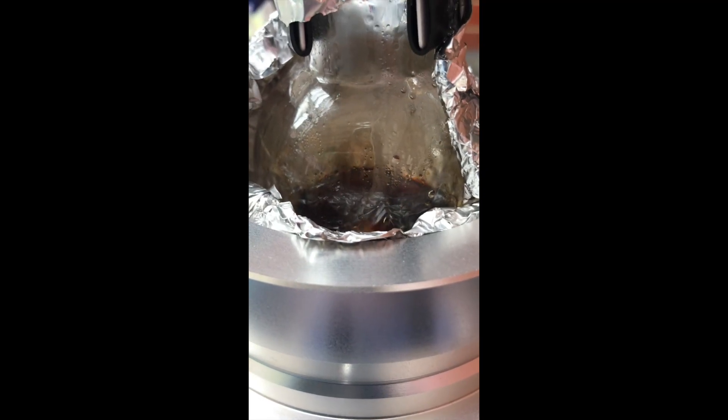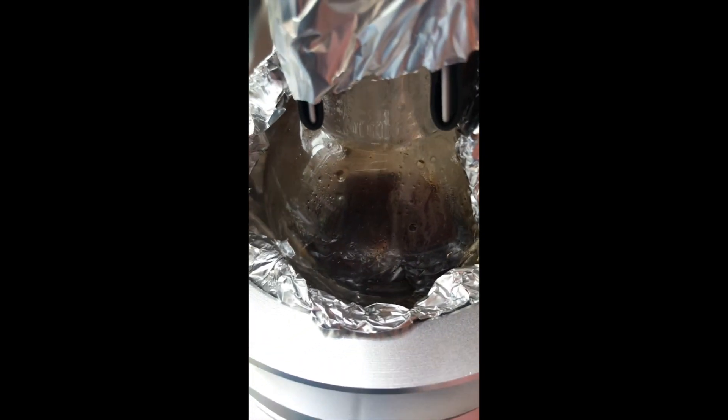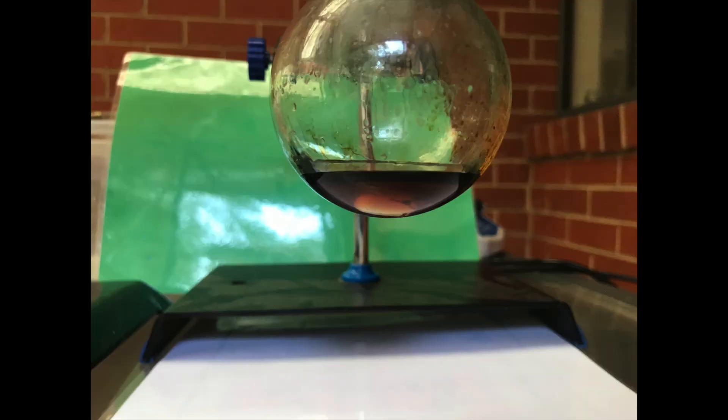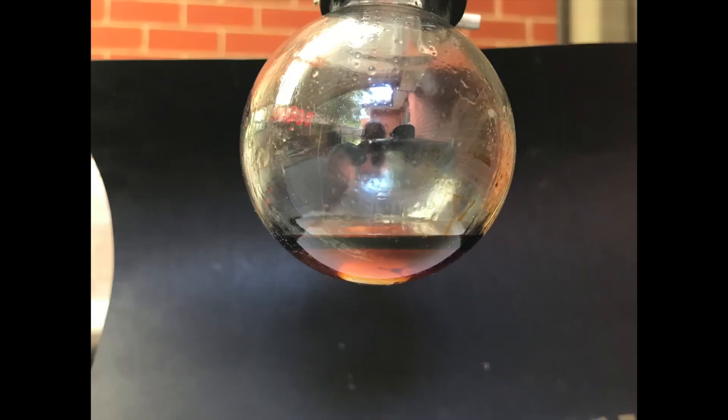The dark liquid in the unpurified acetone flask I thought was acetone as it had a strong distinctive smell. However when I attempted to light it on fire it would not catch on as it was not flammable. This leads me to the conclusion that all the acetone came across as well as a little bit of water.